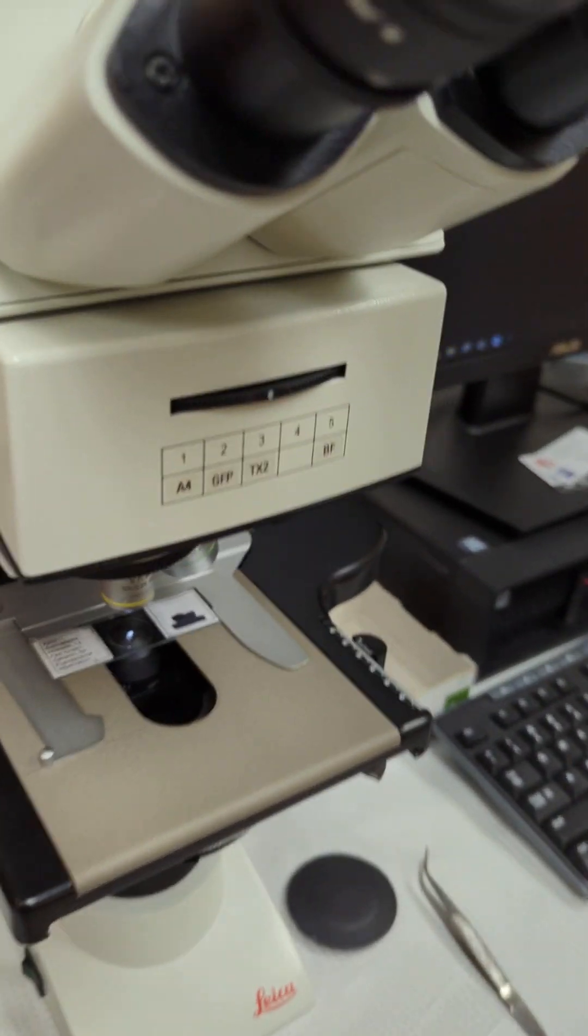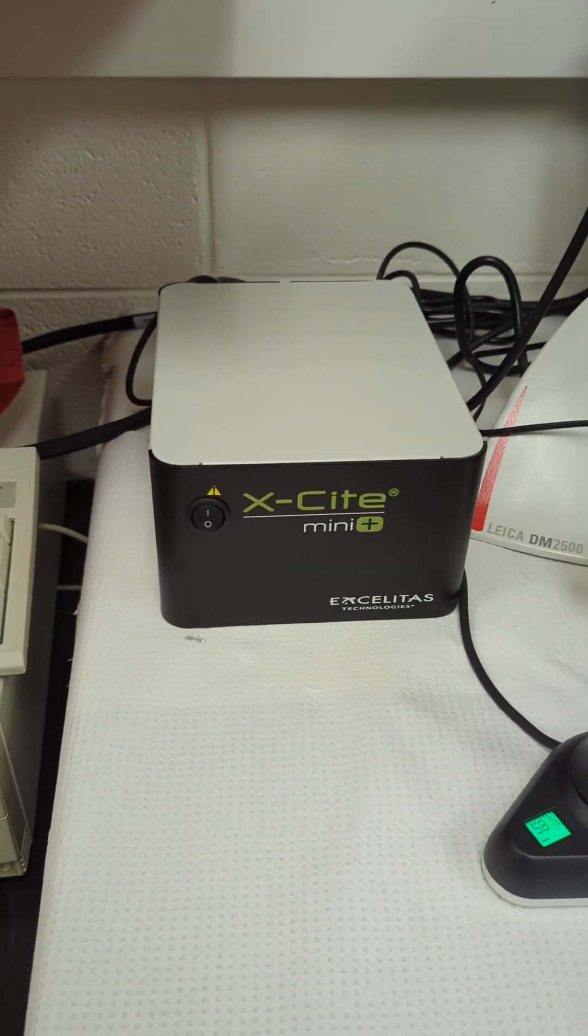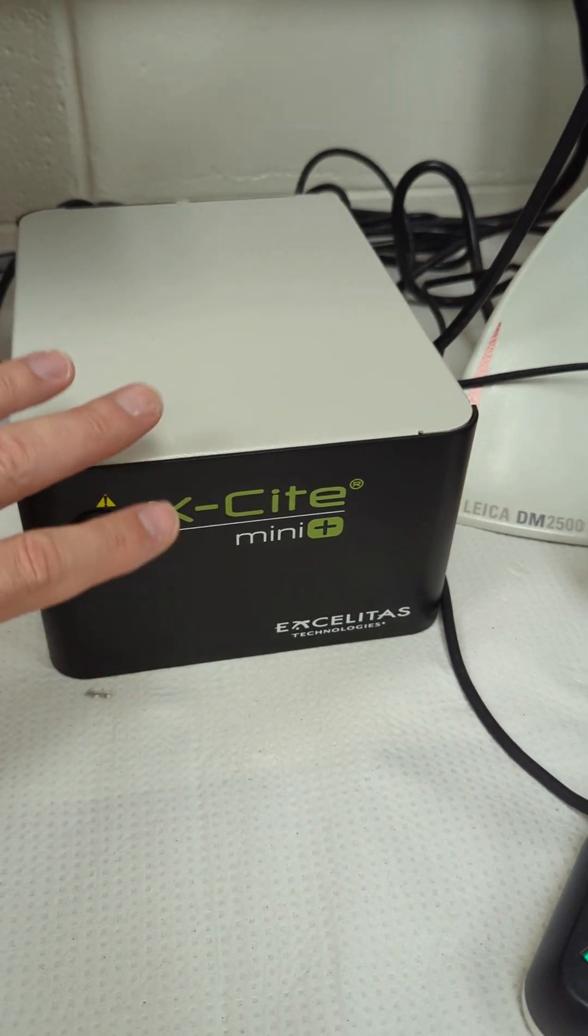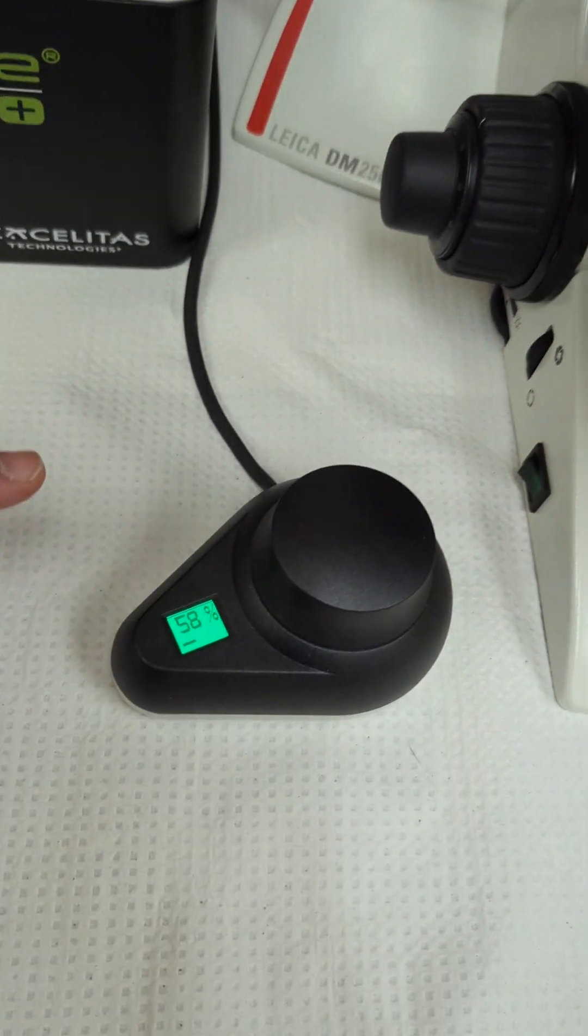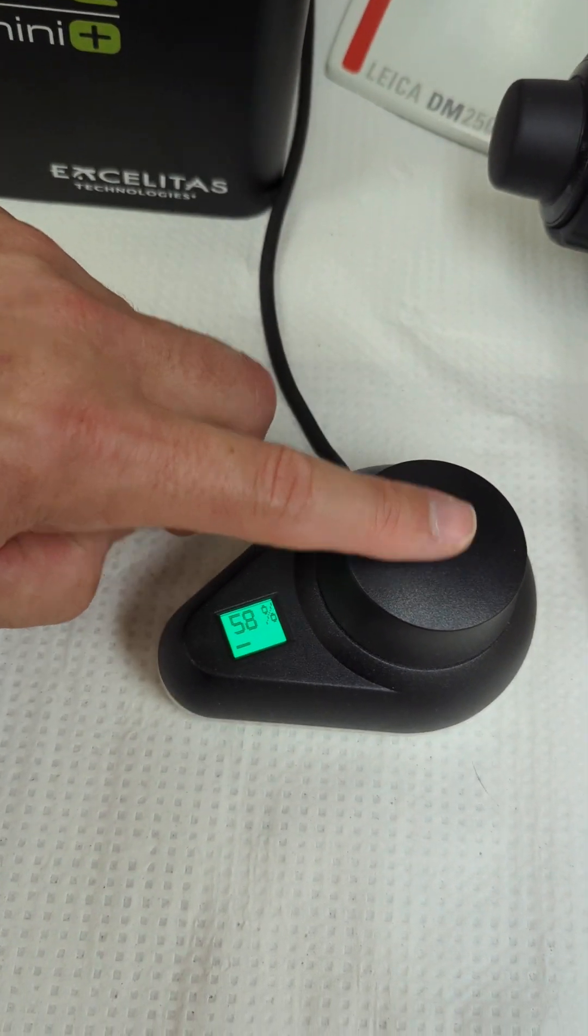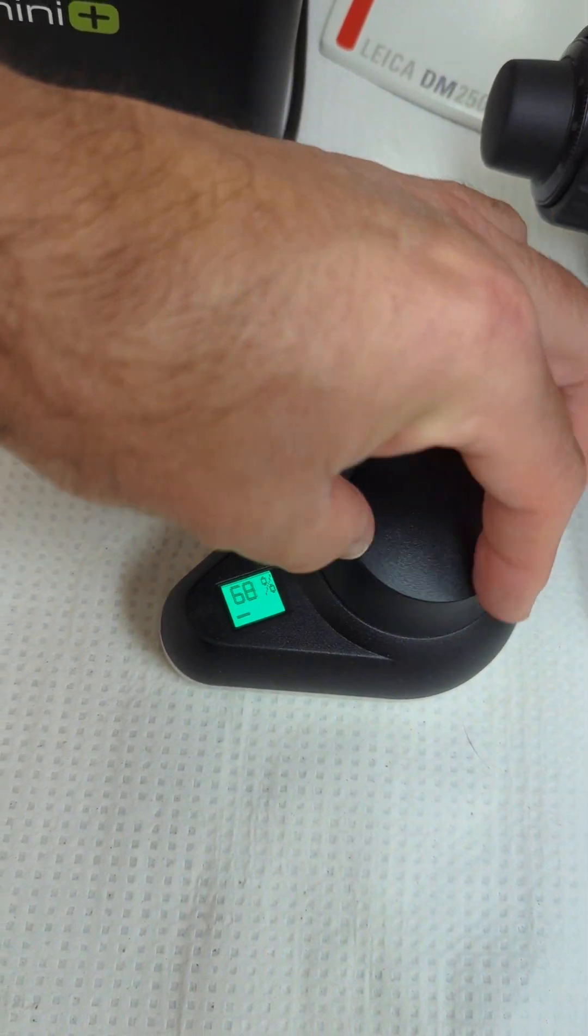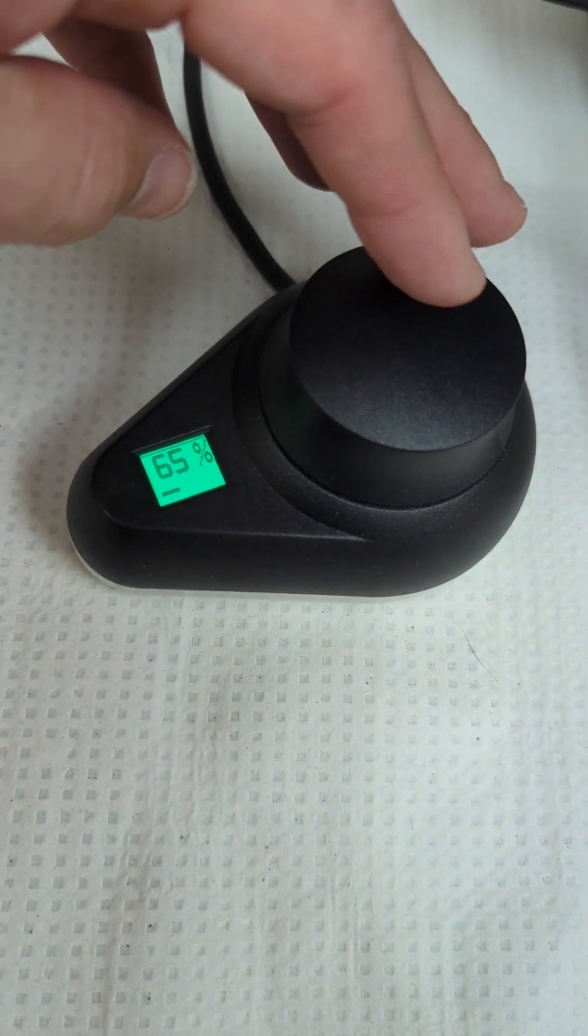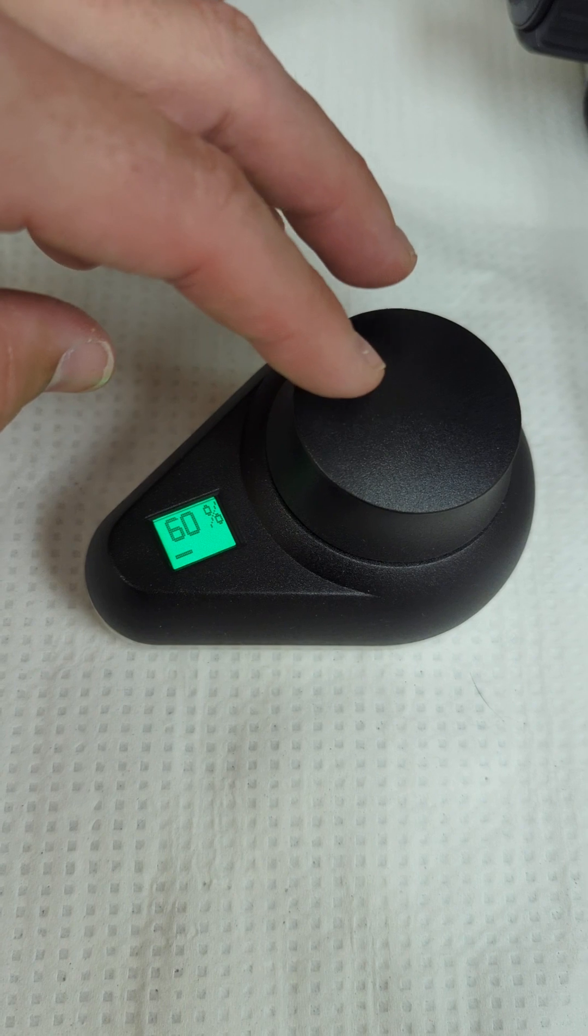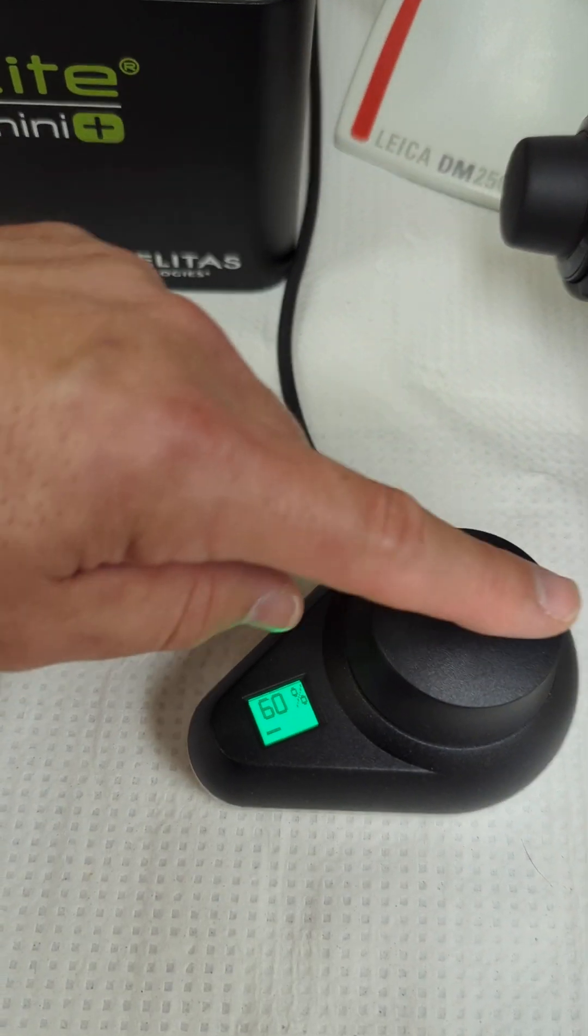Moving down here to the fluorescence illuminator, this is your power switch, and this is your fluorescence with the handle. In order to operate that, you just push. This dials how much intensity you want on that fluorescence.